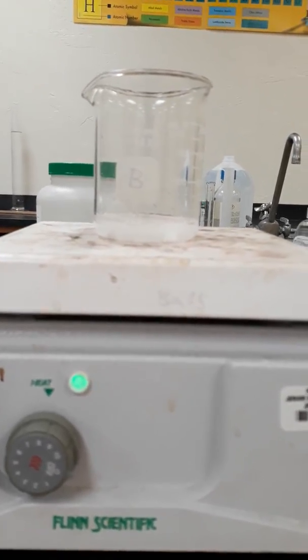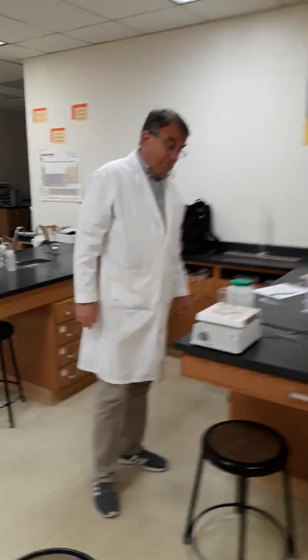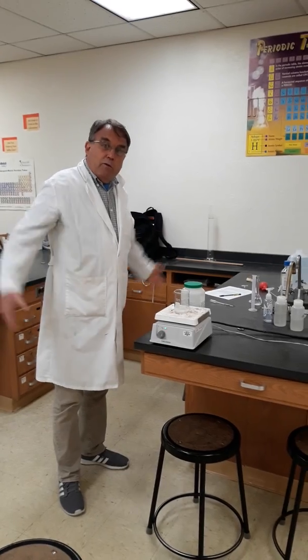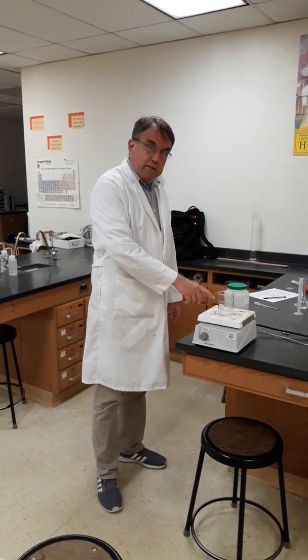And this is some downtime. So normally if you were in the lab, we'd be doing the post-lab calculations. But through the magic of video, we can just pause this and then come back in about 10 minutes when it's nearly completed.